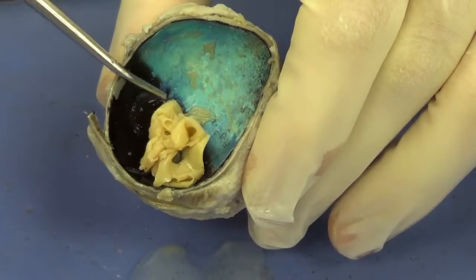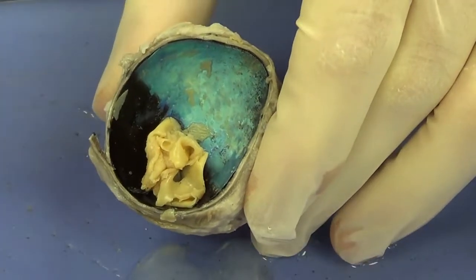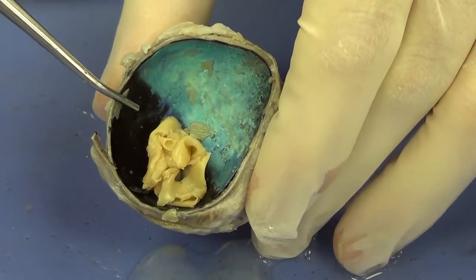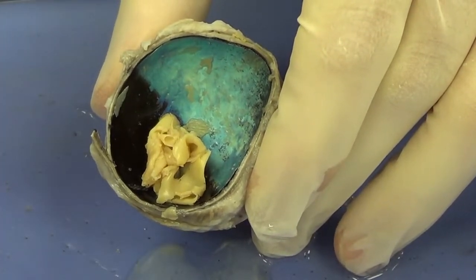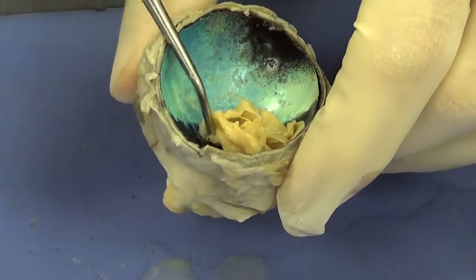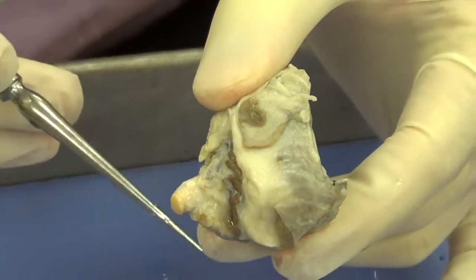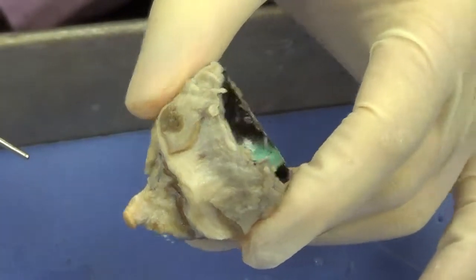And the spot in the retina where they actually pass through is referred to as the optic disc or blind spot because light cannot actually be detected there. Now all these axons pass through the back, and if we look exactly opposite of that optic disc, that is where the optic nerve is, all those axons are going to make up the optic nerve. That is where they exit and go to the brain.